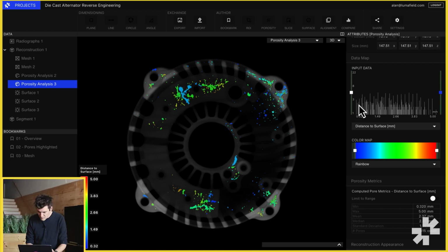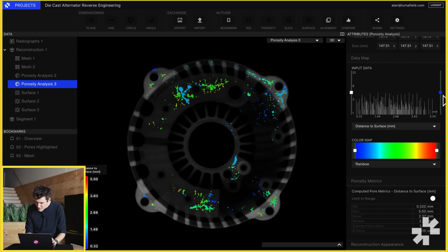In Voyager, we calculate 3 different pore metrics: pore size, sphericity, and distance to surface. The third metric, distance from surface, is the minimum distance between the pore and the surface of the part. This can be really useful if you're going to be post-machining that part and you want to understand whether in that machining operation you have sufficient stock to not open up that pore. Looking at the distribution of distance from surface metrics, we can see that our deepest pore is about 5 millimeters into the bulk of the part.